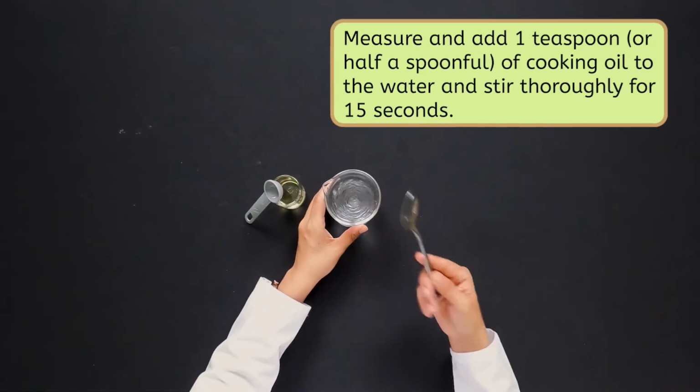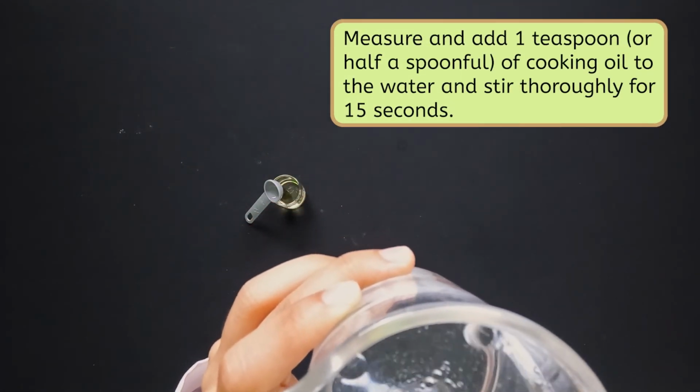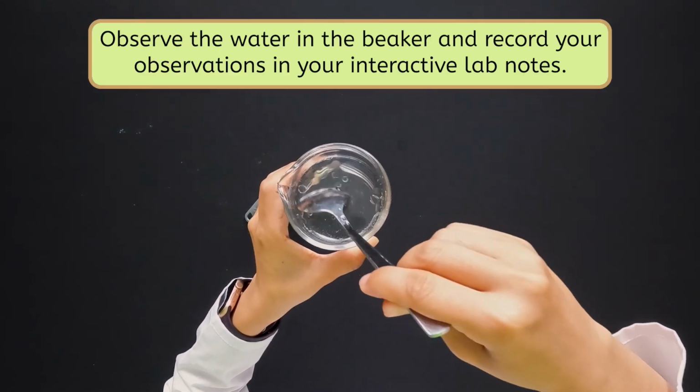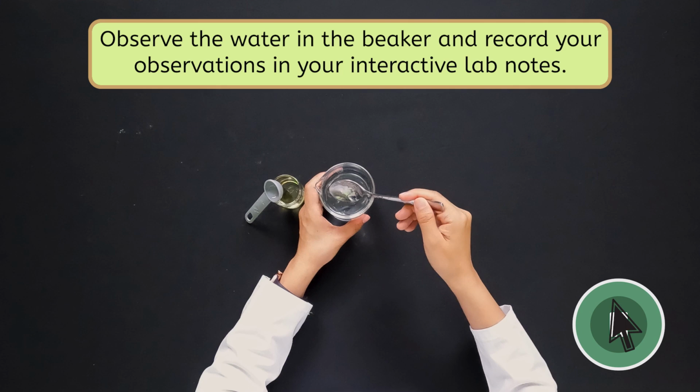Observe the water in the beaker. Did all of the oil dissolve? Make sure to pay close attention to the surface of the water in your beaker. Pause and record your observations in your interactive lab notes.